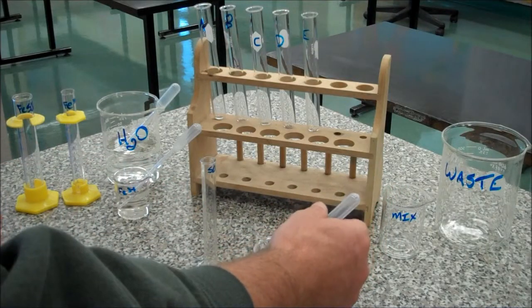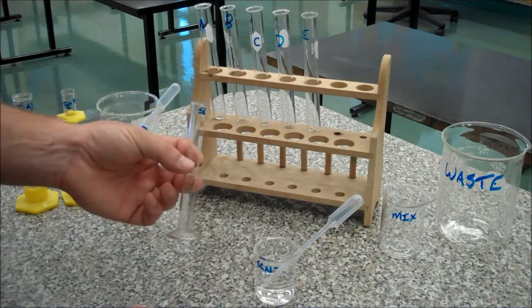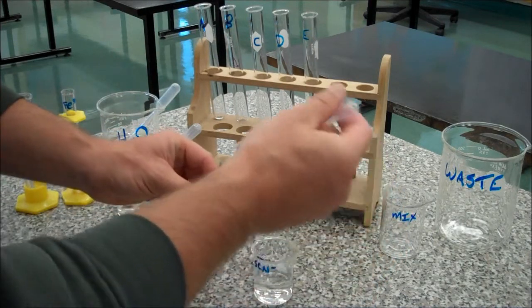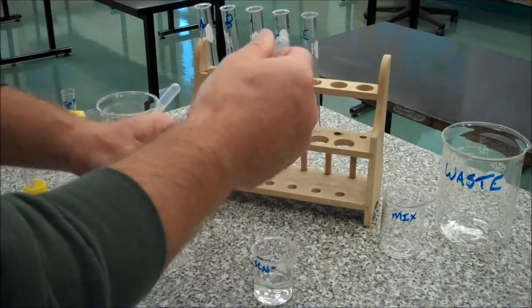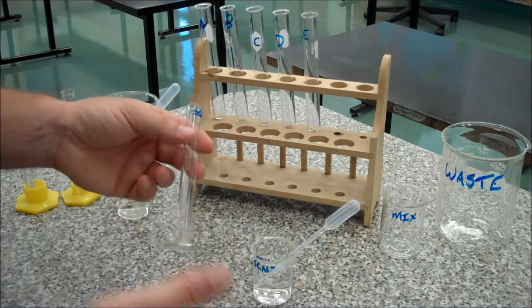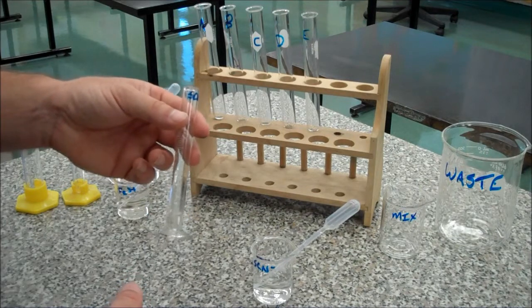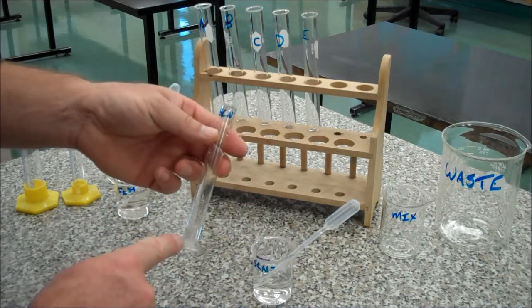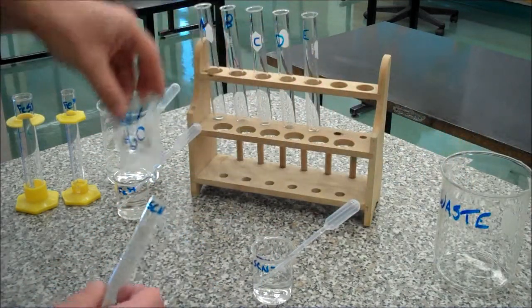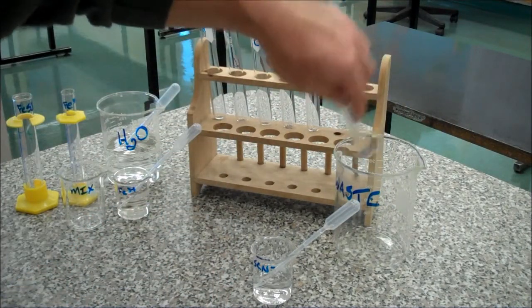So this one's potassium thiocyanate. I'm going to equilibrate my glassware — what that means is I'm going to rinse it. The reason why I'm going to rinse it — I'll just use a pipette full and I'm rinsing it down the sides — is that maybe there was some water left in there, some contamination of some kind, and so it minimizes the amount of cross-contamination you might get. Okay, so this is waste now because it's my rinse, and so I'm going to throw it away into my waste container. That is waste.